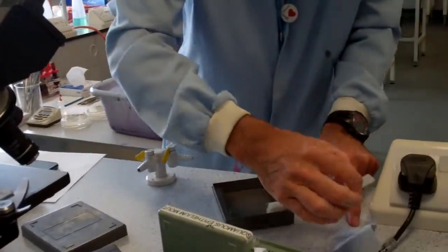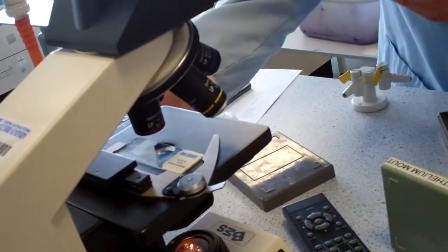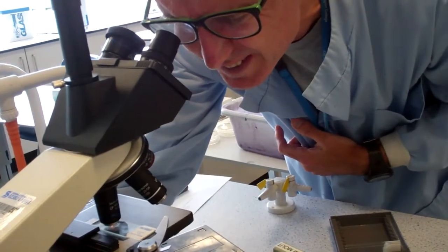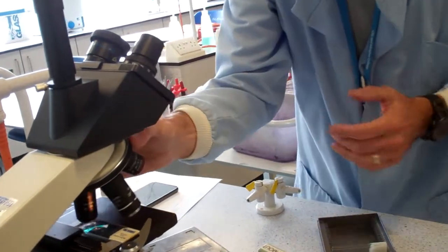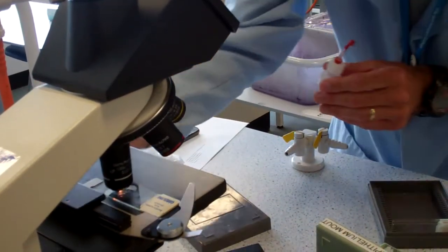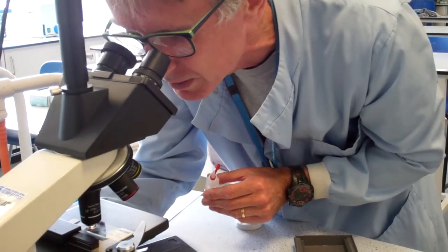So I've got the same sort of cells. I can go back to the red lens again, clip the slide in. That's already in focus. That's good. Okay, a drop of oil, and then I'm going to move the white 100 times objective lens in, focus that. Once I can see individual cells, I'm going to move the graticule around and line it up against one cell, and it can help sometimes to move it slightly so you're lining up a cell right on the line.